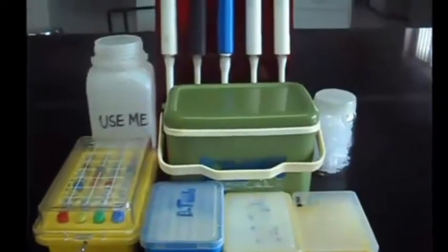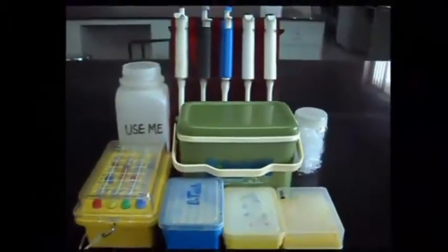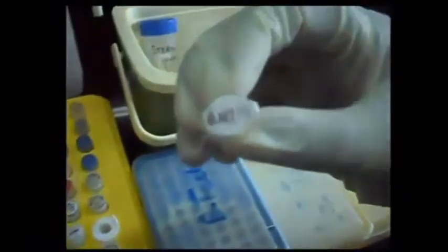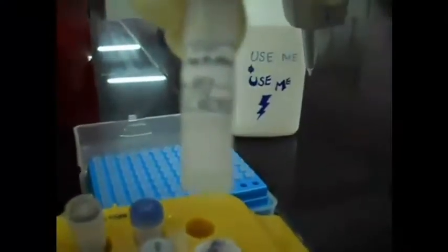Do's. Make sure all the things are available in your work area. Wear clean gloves and lab coats. In cocktail preparation, prepare the dNTPs freshly. Check the concentration of primer. Check for the presence of magnesium chloride in buffer.